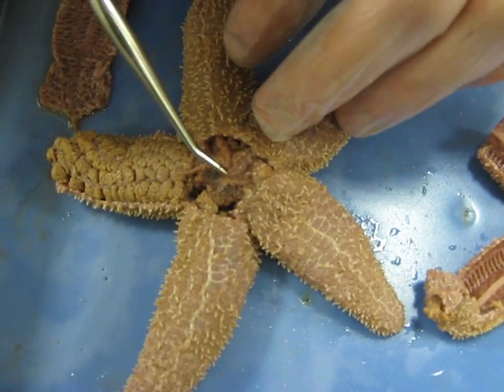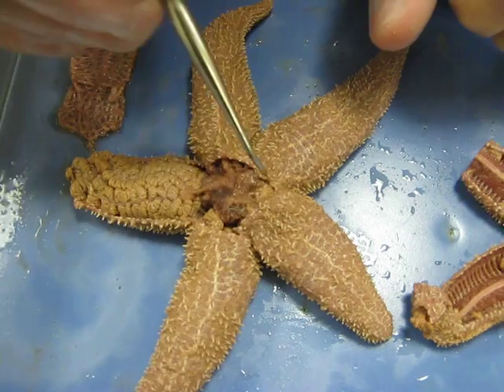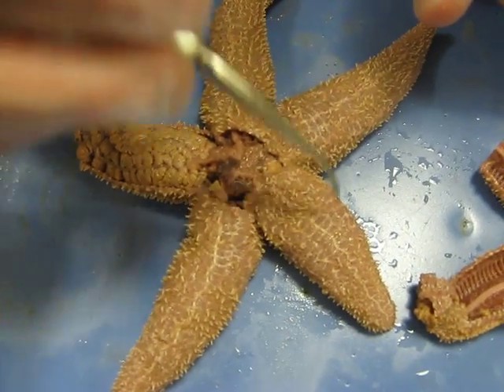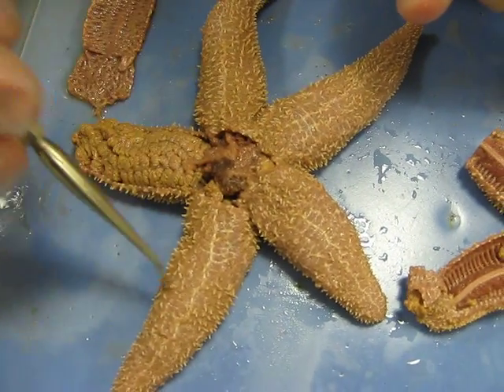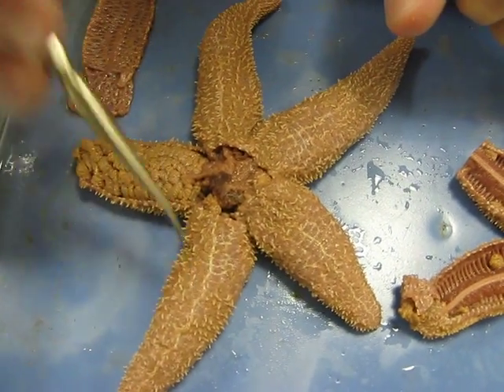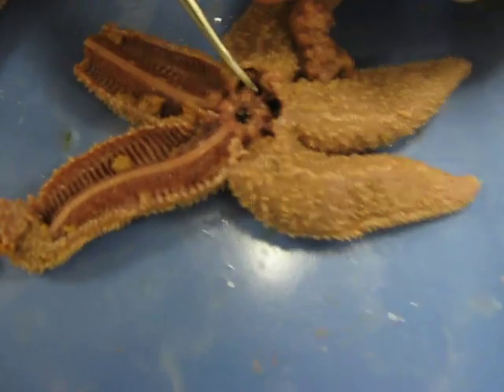The bivium and the trivium — at the madreporite we have the bivium, these two are called bivium, and then trivium. And then this is the anus.